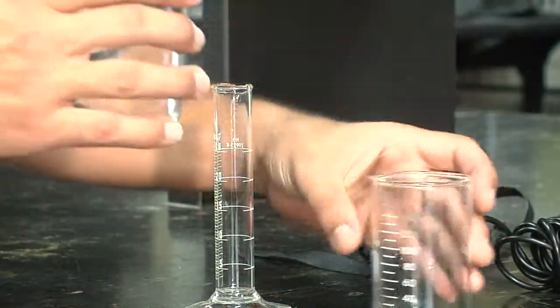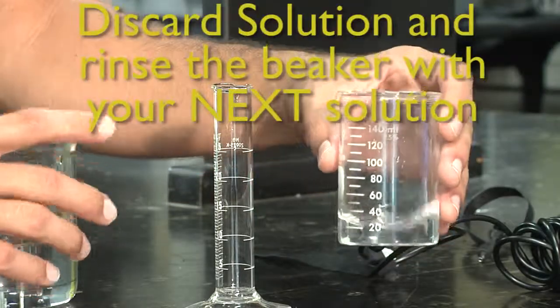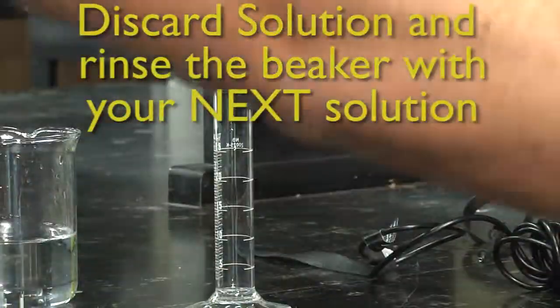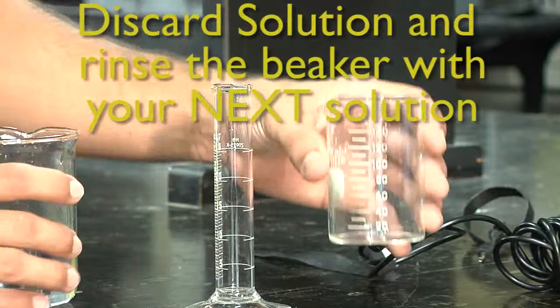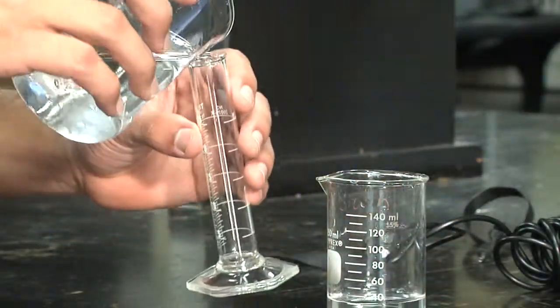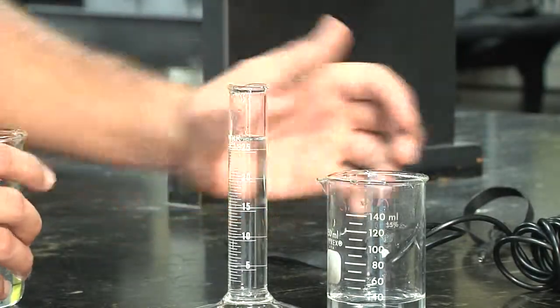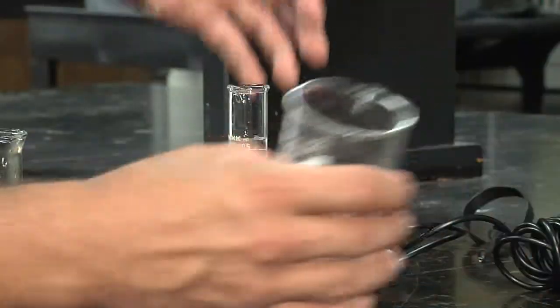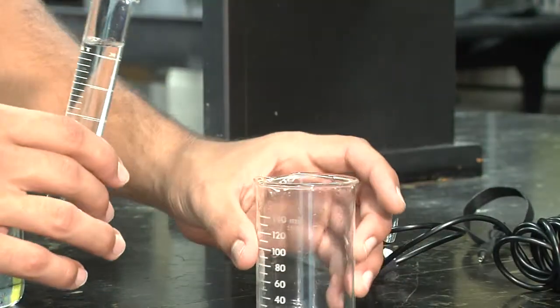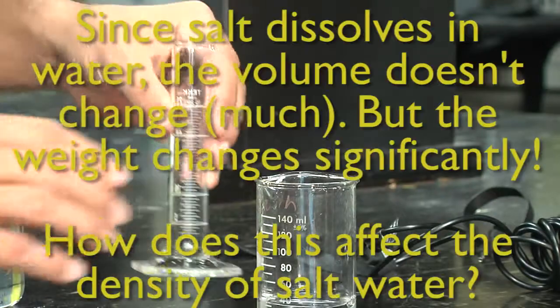And we're going to rinse our beaker with the new solution of 10% to just clean out any of that 5% solution. And finally, you will be measuring out 25 milliliters of your new 10% solution and seeing if that has a difference in density. And that is basically all of Lab 2.